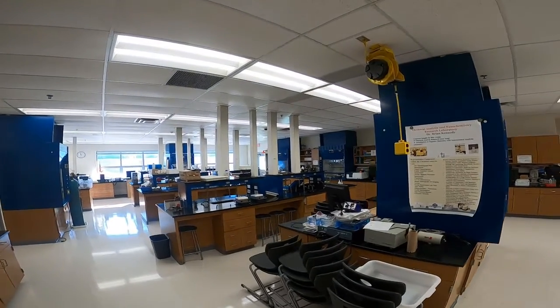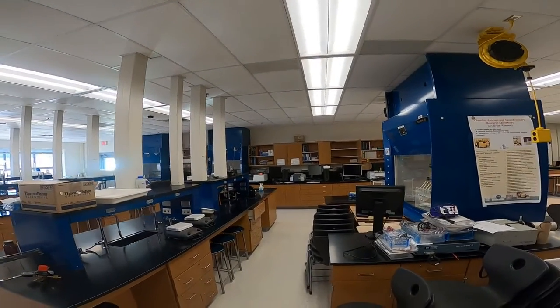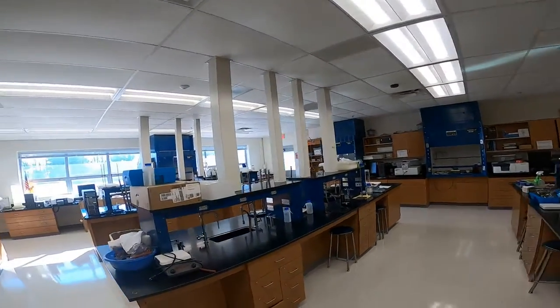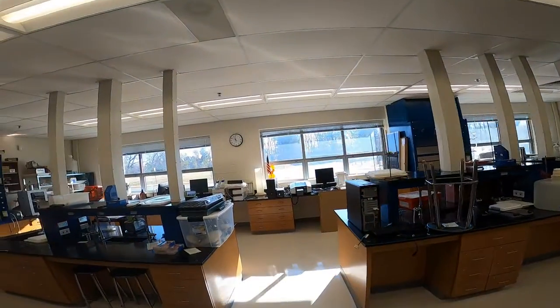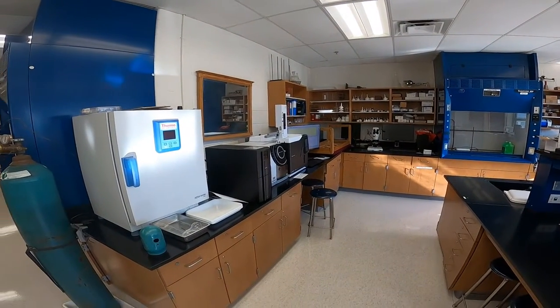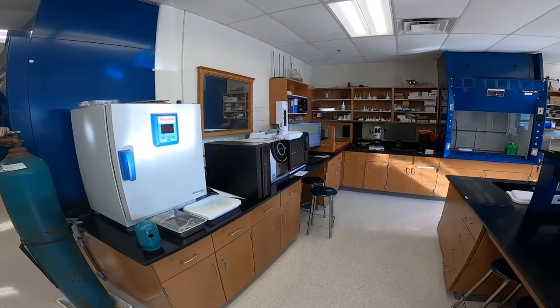So my goal today with this video is to show you the lab and highlight some of the equipment and some of the things that can be done here. And then later I'll have a separate presentation to talk about the course itself, the prerequisites, and some of the topics in the courses. In the lab we have a variety of equipment related to chemical analysis that can be used in the organic chemistry lab for determining molecular structure and studying reactions.